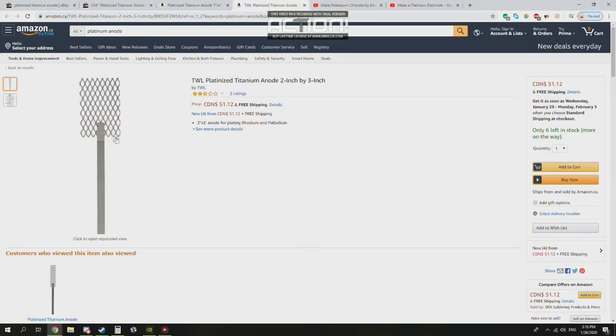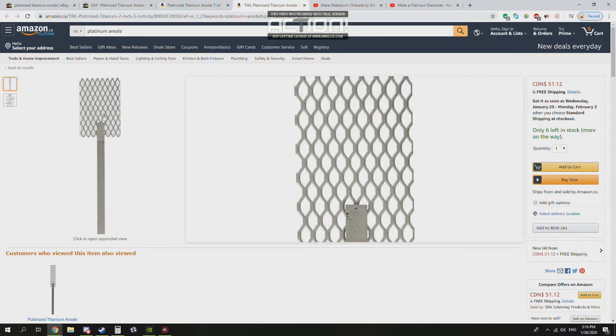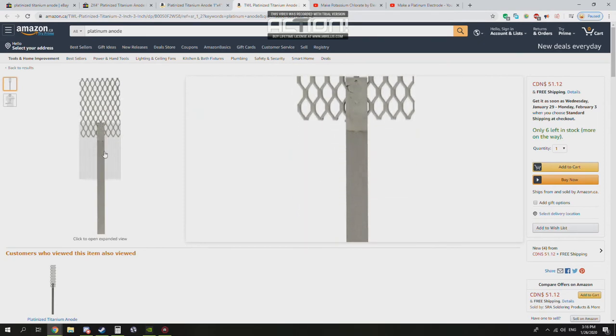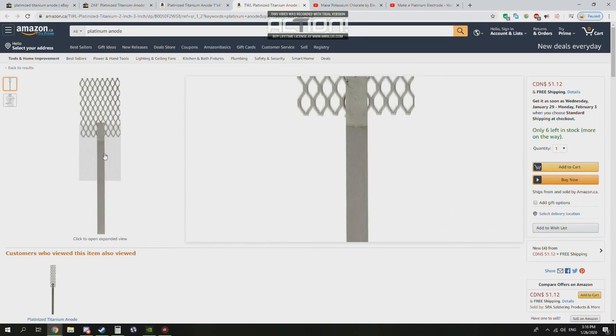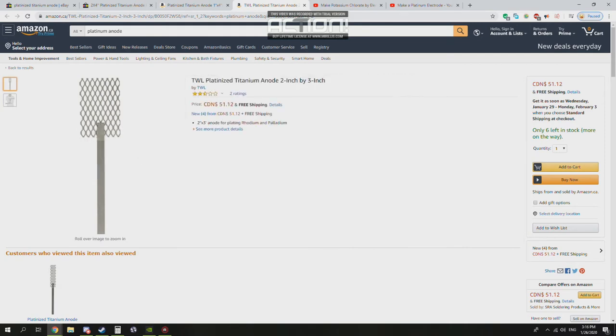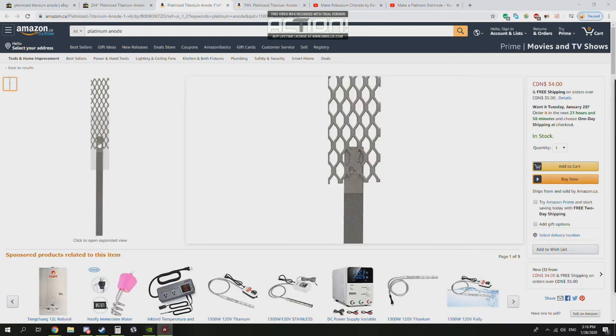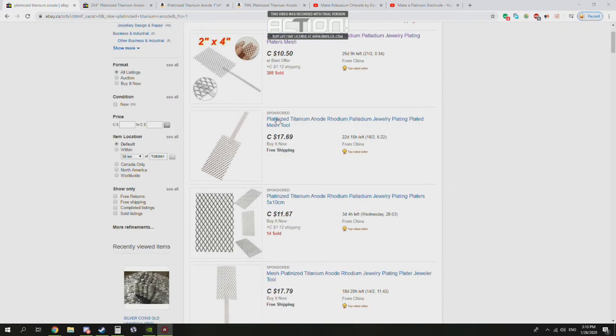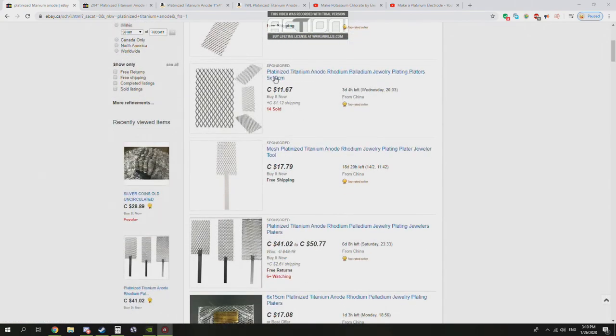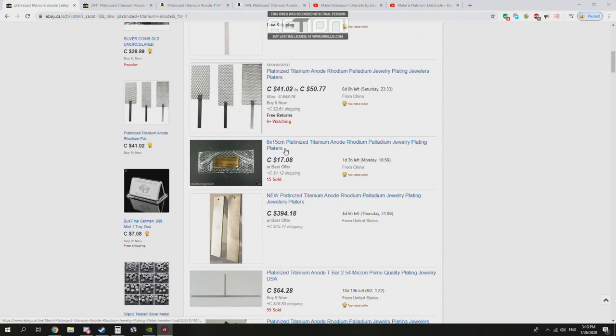And this one is the one that I'm using, you can see. It's the exact same as the other one. It's got that very defined line. It's got the nice coarse texture, grayish. So these are genuine. These two are genuine. And so with all that being said, just most importantly, make sure you know where you're putting your money. You know, know where your money is going.